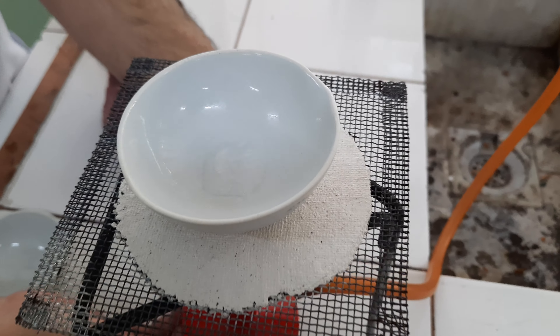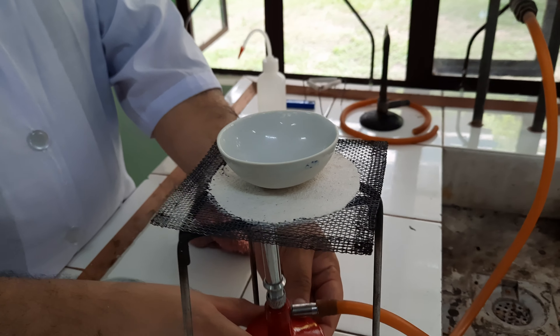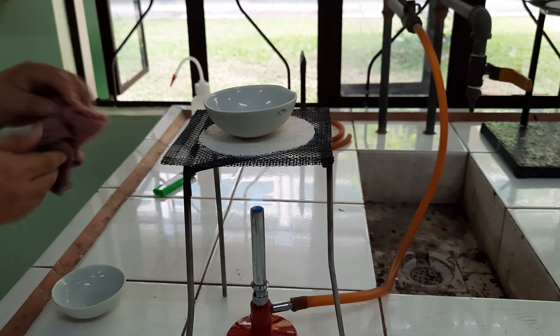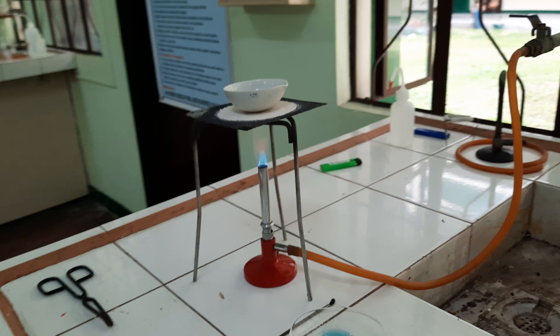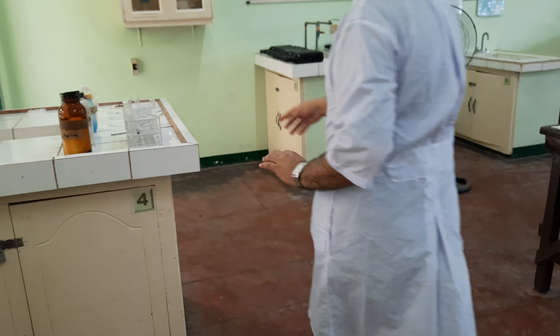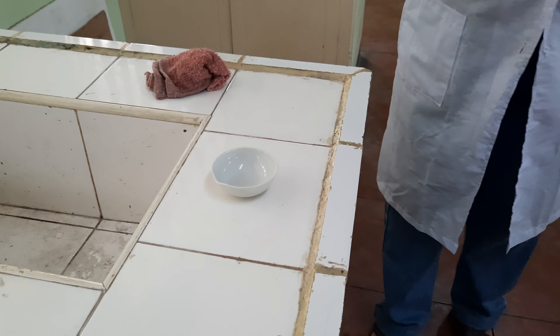It's starting to boil. Let's leave that water boiling — I hope that is a very common experience of ours, boiling water. Let's proceed to the next reaction. I'll pour in a small amount of alcohol — ethyl alcohol.